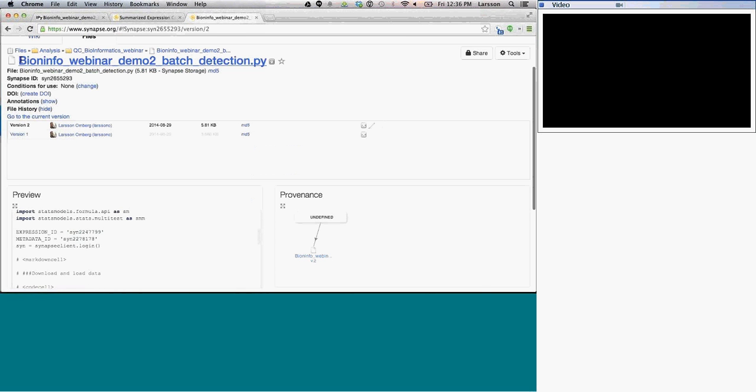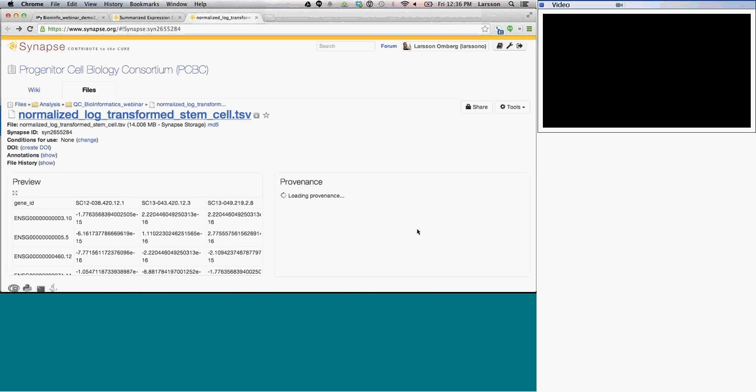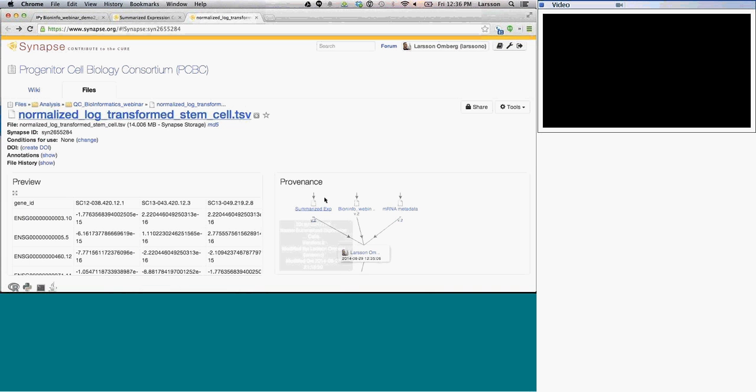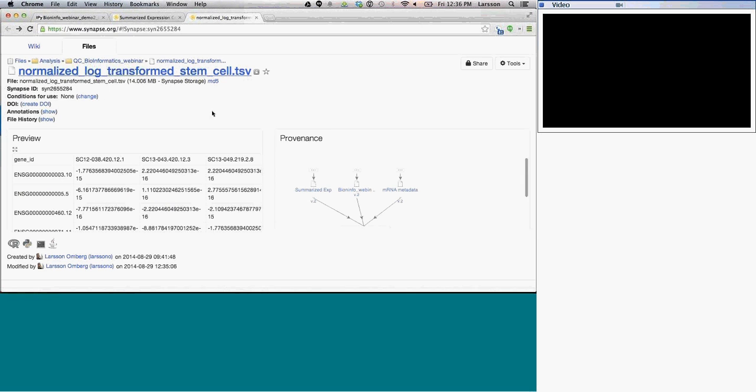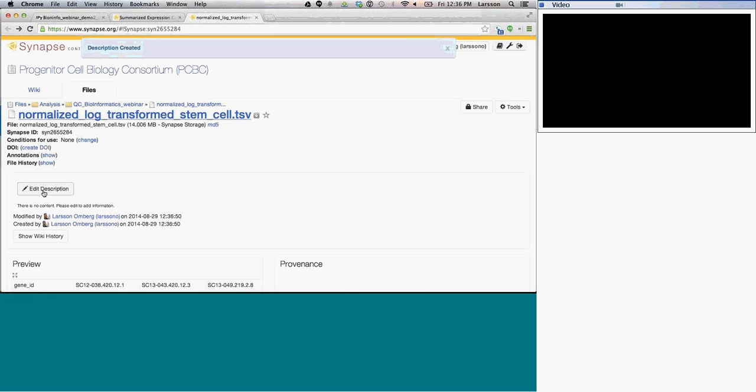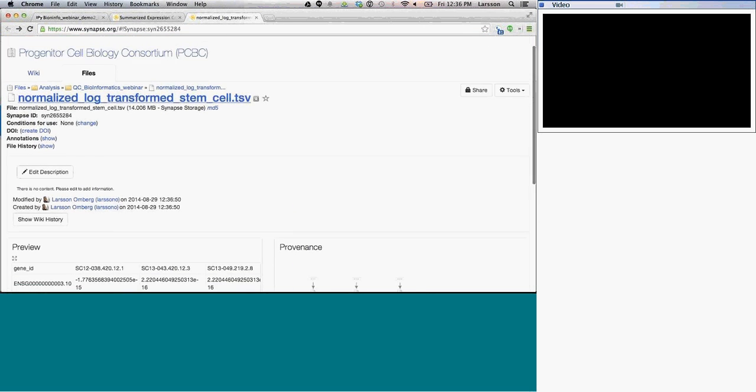So there's code that we ran. If I go back, we can see that I used the original metadata as input, and I used the summarized expression call as input. It's also worth noting here that I can add more descriptions if I want. I can go and add a wiki page to this, add a description, and now I can add free text to describe what I did as well. So if you're using this to share with collaborators, it could be helpful for them.